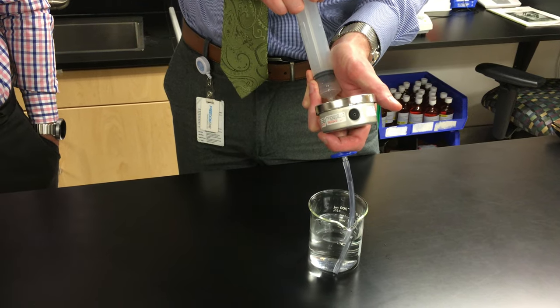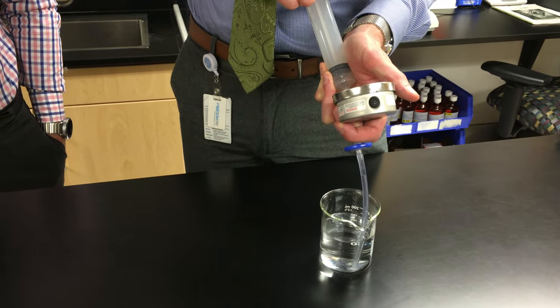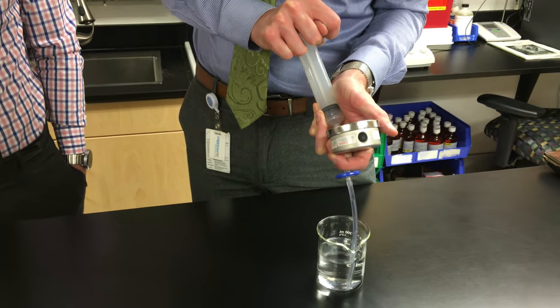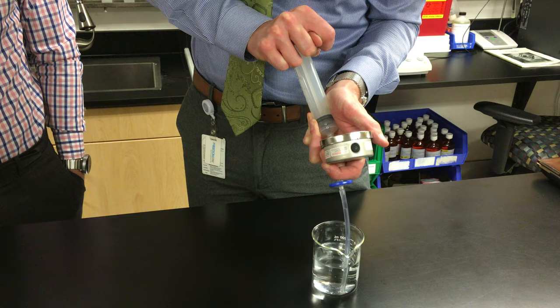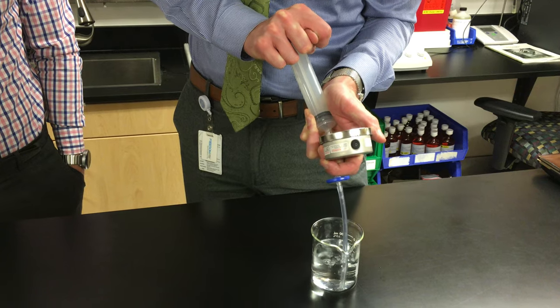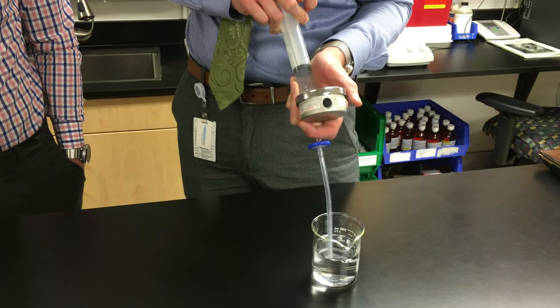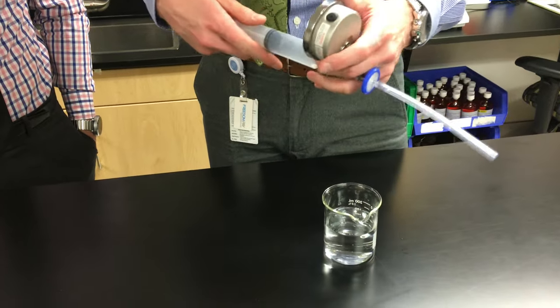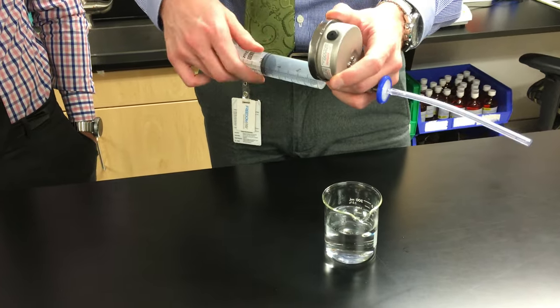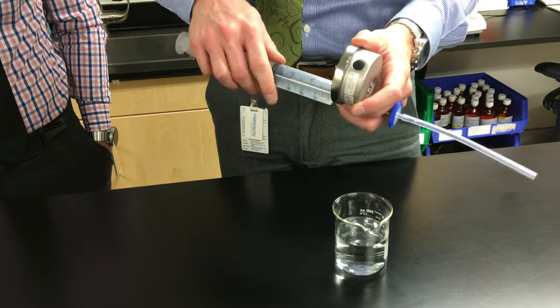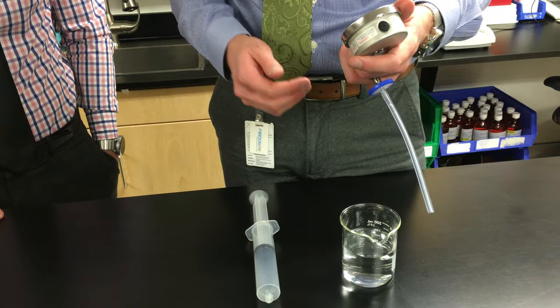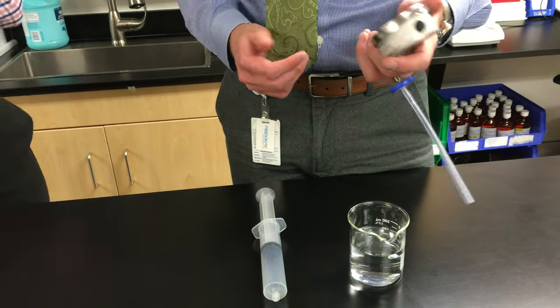I'm trying to get to 50 PSI where this one is rated. I'm at 45 right now with no bubbles. Now we're at 50. That's a lot of force. If I continue to go harder, 60 PSI was where the bubble point for this filter is at, as expected for a brand new filter. It passed the test because it didn't reach its bubble point until 60, while 50 was what it needed to pass.